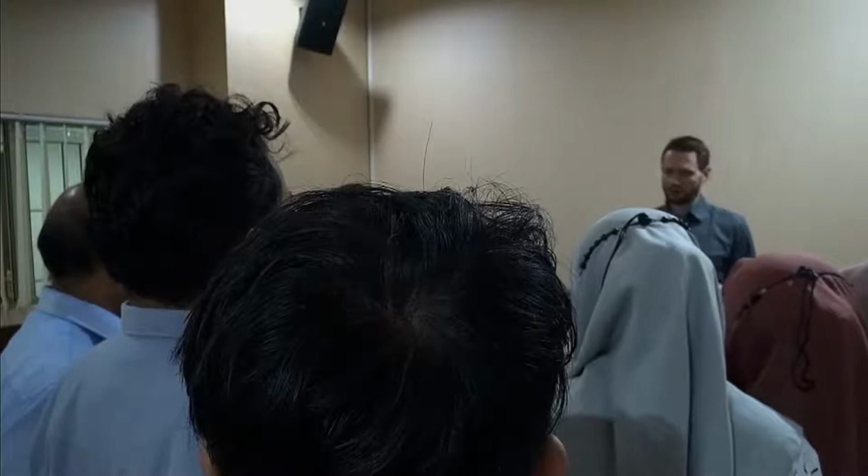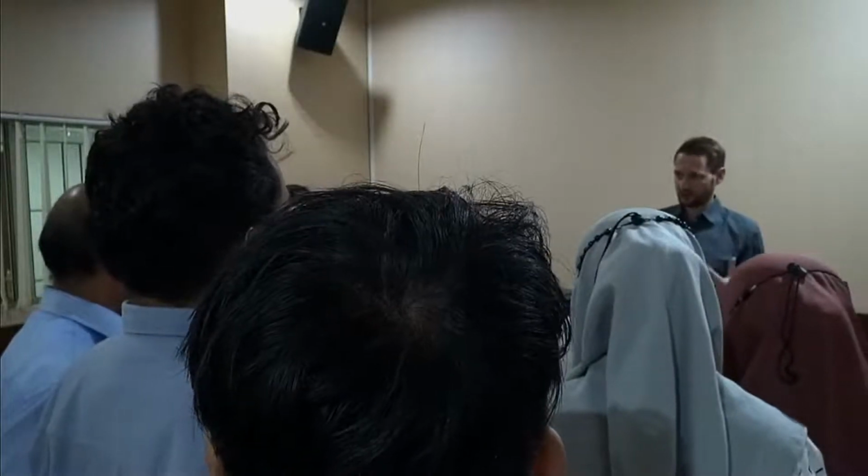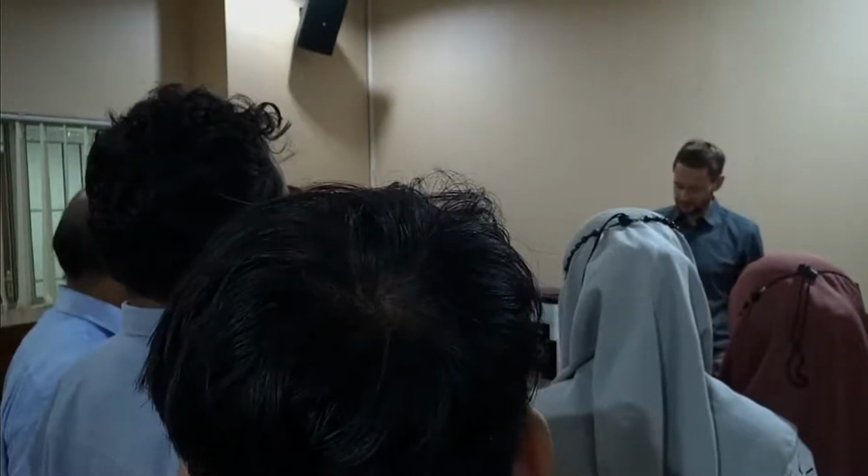At the same time, we also use this. You see the Fritsch sticker, this is our internal standard. So it's not NIST traceable, but what we do is we bought a huge batch some time ago in order to prevent the batch from changing. So we always have the same batch and take small portions of it. We also measure this during the final testing procedure. The advantage is we just give you this for free.